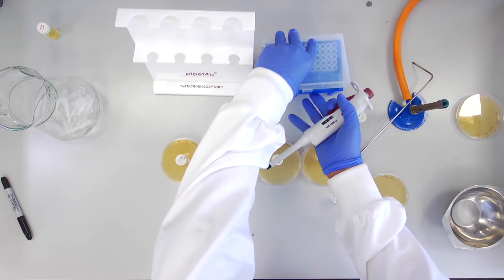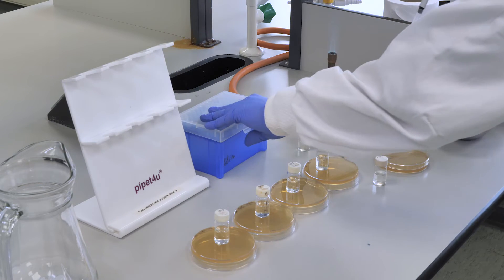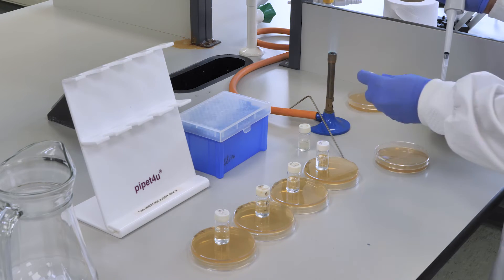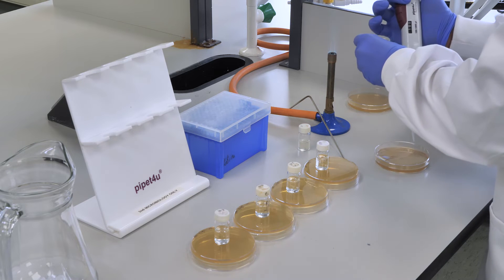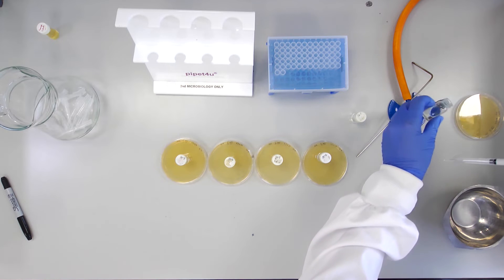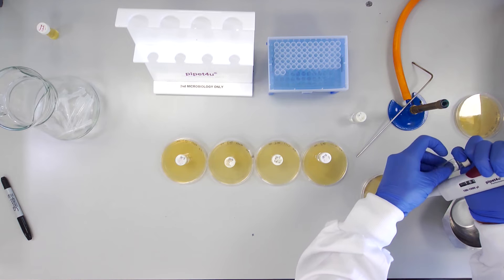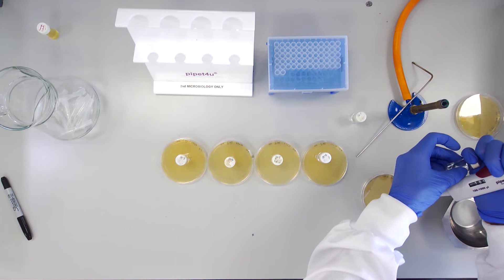Using a new tip for each of the dilutions, transfer 100 µL and spread each dilution on the corresponding plate in the same manner.